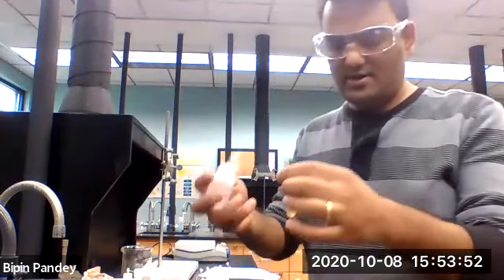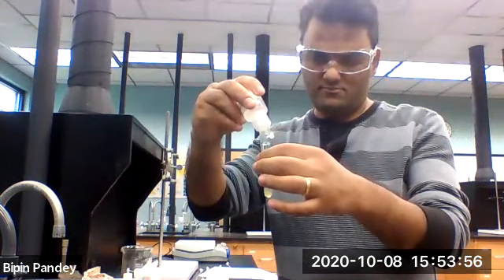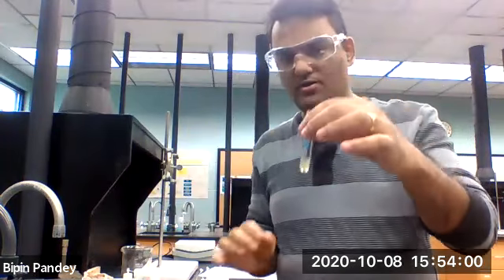So let's add iodide to it. Again, I don't see any precipitate.